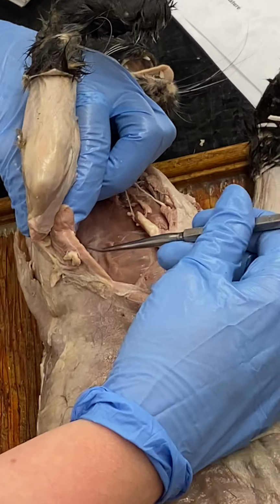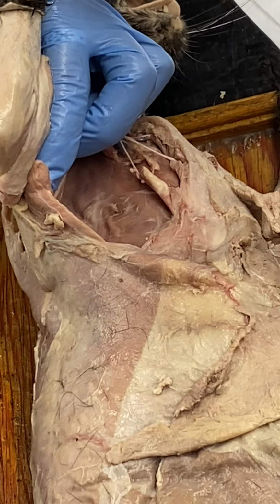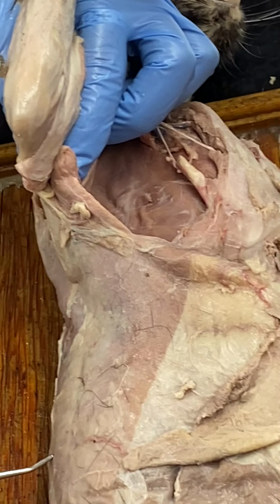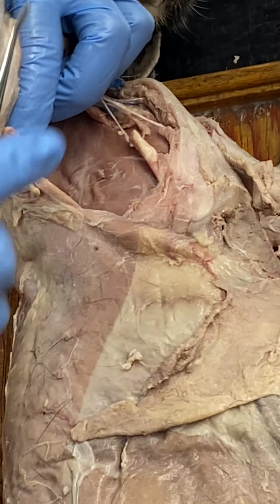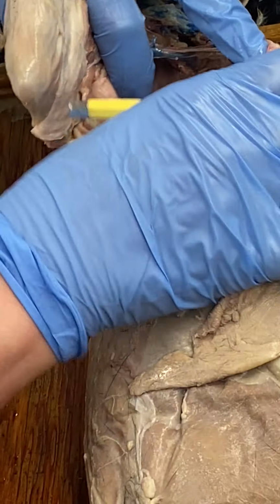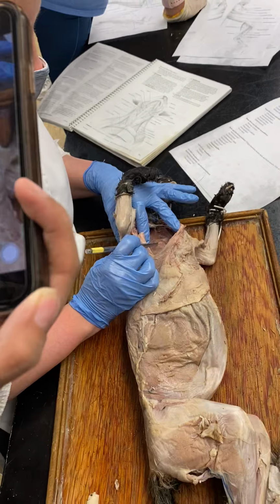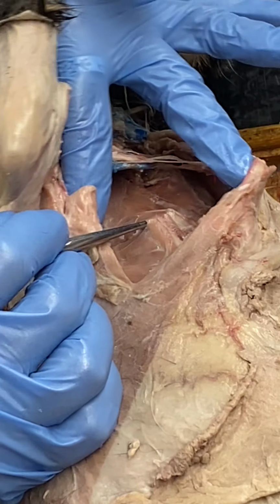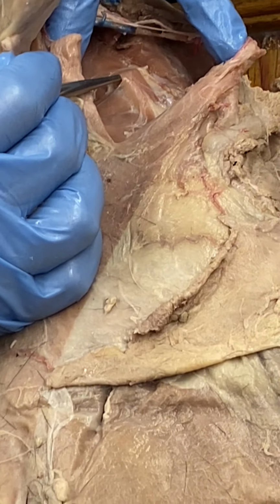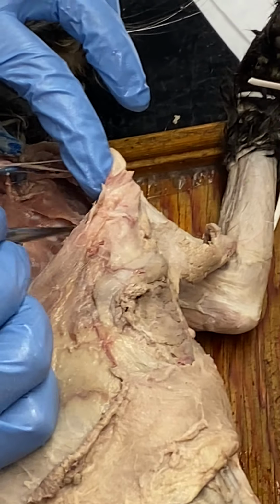Serratus ventralis, that's that fan-shaped one, kind of sits flush up against the ribs. Good, okay. Scalenus and transversus costarum are strap-like. Scalenus sits a little bit farther out. Scalenus. Okay. Transversus costarum, more towards the midline.